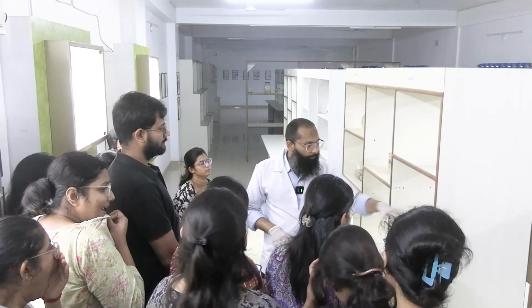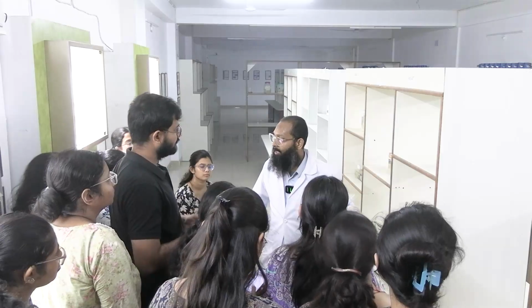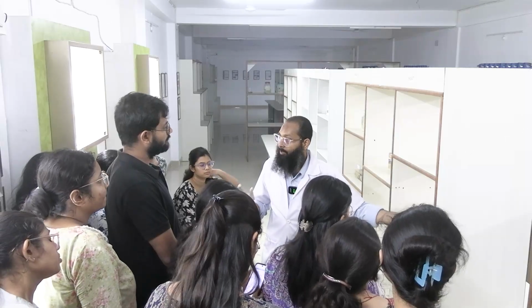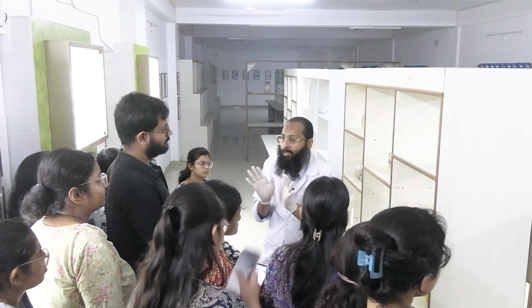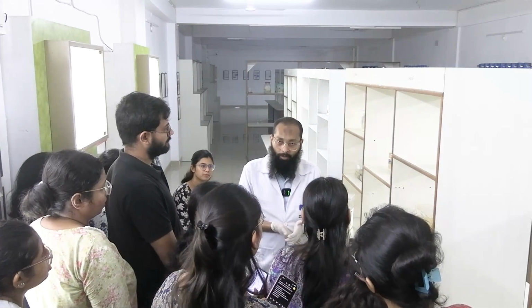Next we go for the tumor proper. Okay, then we go for the tumor proper. We generally take 2 or 3 or 4 sections depending on its size, how large it is. We take the sections from the tumor proper. Then we take sections from each representative area from the 4 quadrants. What are the 4 quadrants in the breast? Upper outer, upper inner, lower outer, lower inner.